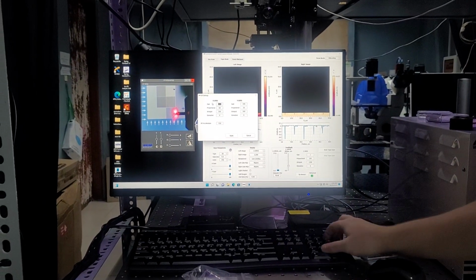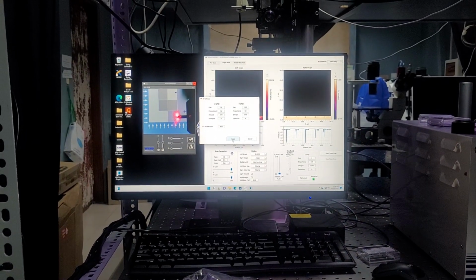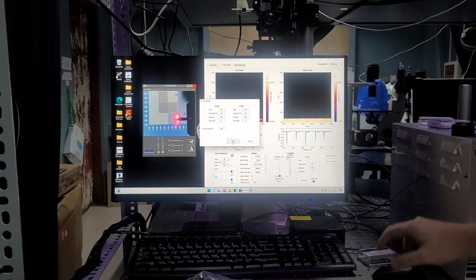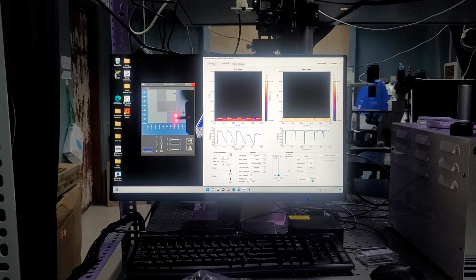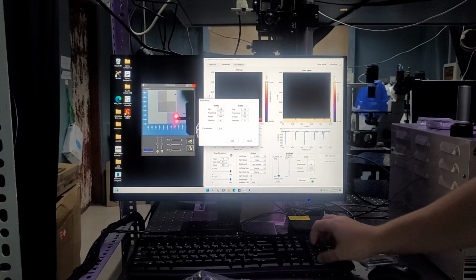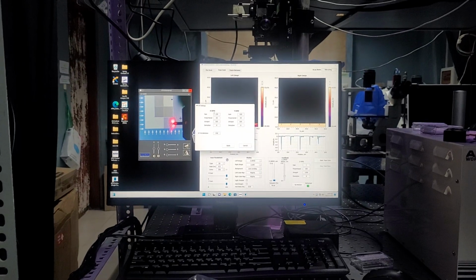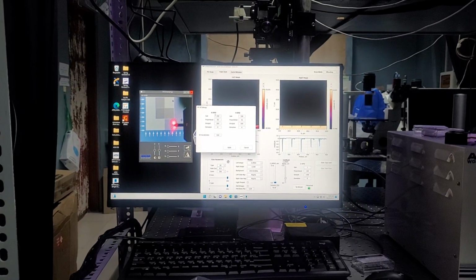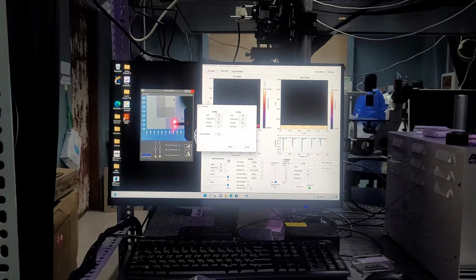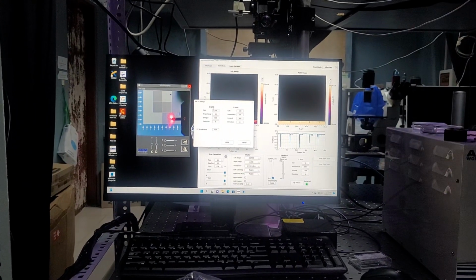For example, if I change this value and click Apply, it might be hard to hear, but it didn't really do it. Typically what it will do is it will kind of click into place. And so if you're on the surface and those piezos move, then it will just ram your tip into the surface. So you want to do it before you tip approach, but you can do it at any point before.